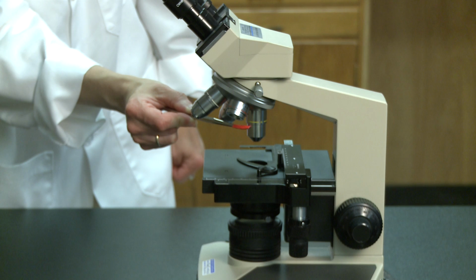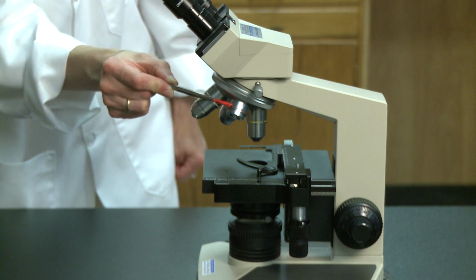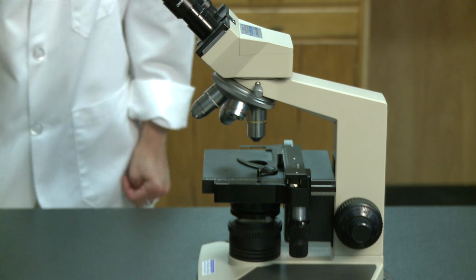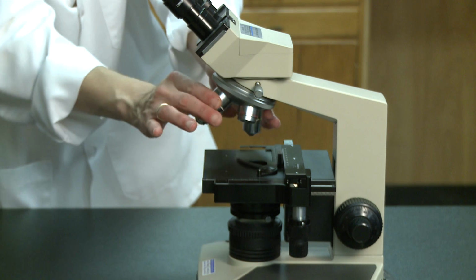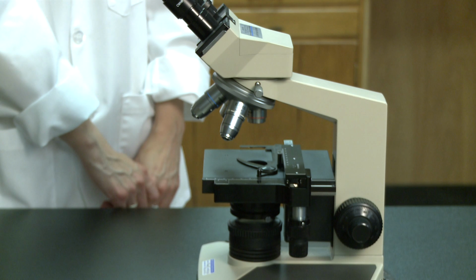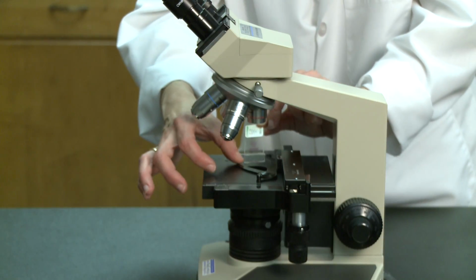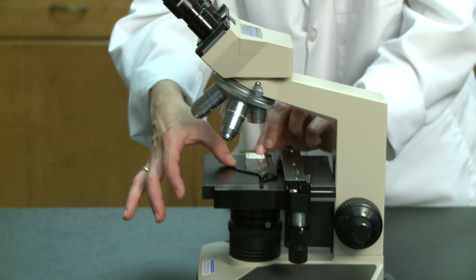And you'll need these higher power objectives later on, but initially you should always view a slide using the 4X or the scanning objective. So before you even place the slide on the stage, be sure that the 4X scanning objective is in place. When you're viewing through the 4X objective, this will give you a wide field of view and a large working distance to focus the image. This simple tip will vastly improve your experience viewing histology specimens with the microscope. Only after the 4X objective is in place and the stage is racked down, you can place the slide onto the stage and be sure to secure it with the stage clip.